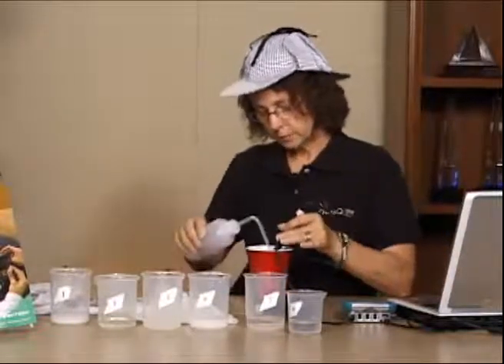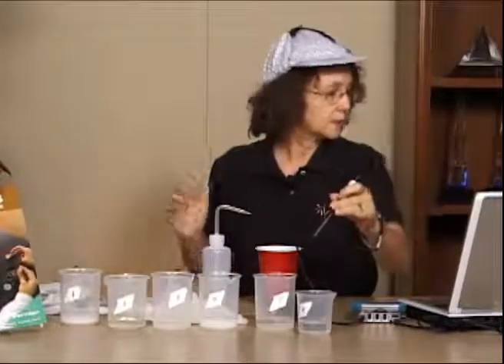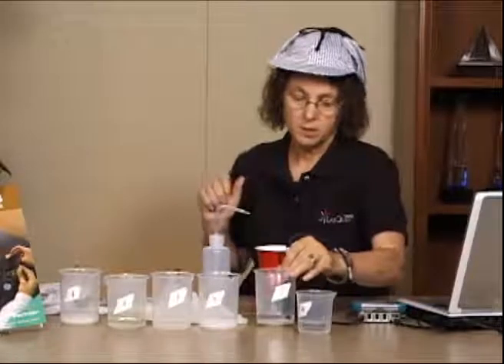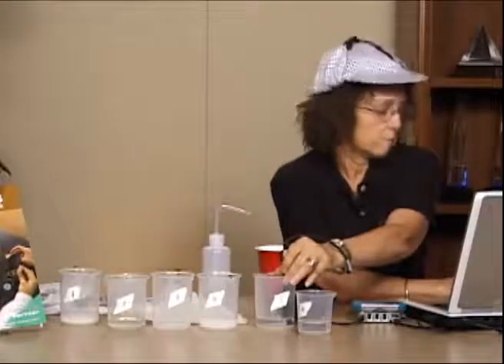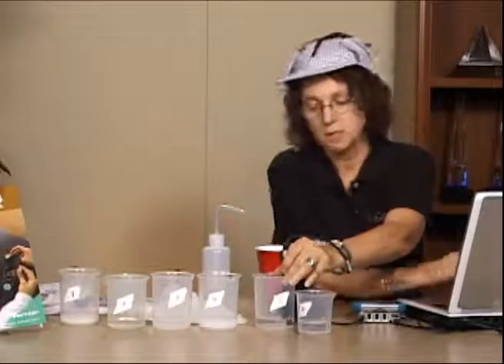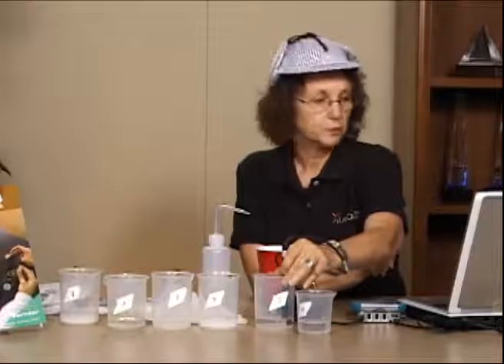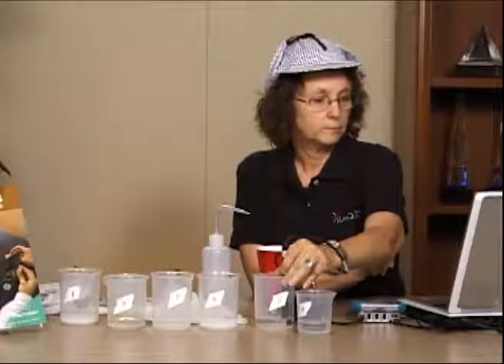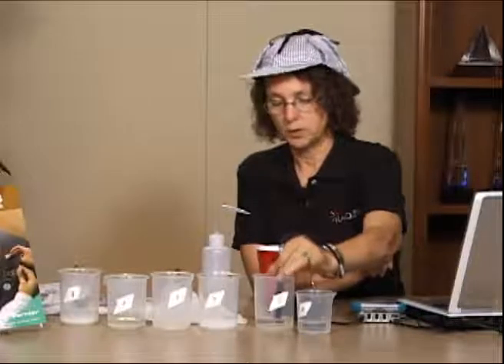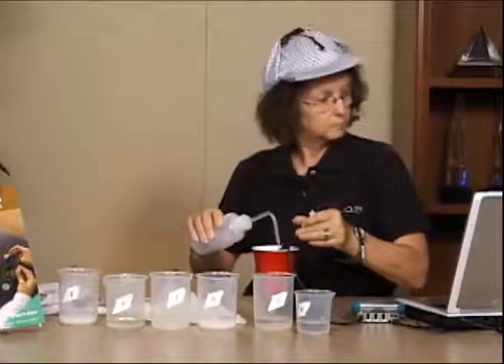The lab can easily be completed in a normal classroom period of about 45 minutes. If you find that it's not working really well in a 45-minute period, there are some things that you can do that will speed it up. One, of course, is to weigh out all the solids for your students. If you only have 1 or 2 balances in the room, sometimes that's really helpful to do. Another is you can cut that 15 minutes down a little bit, but don't cut it down too much, because you do want to give the solids time to react.